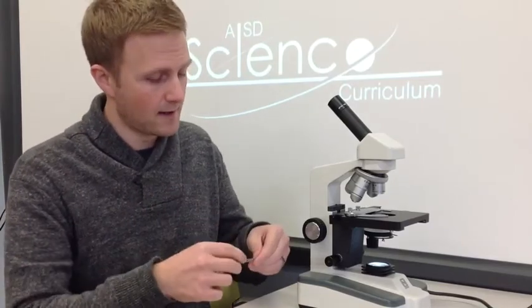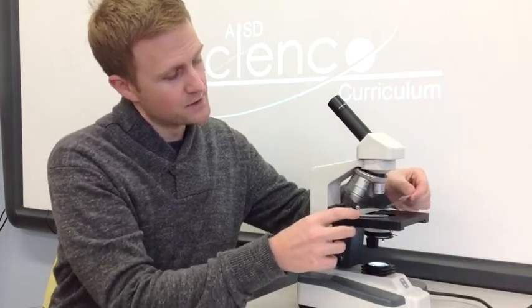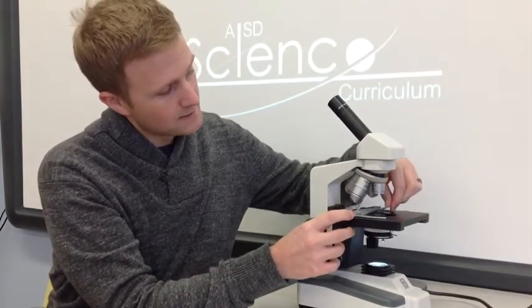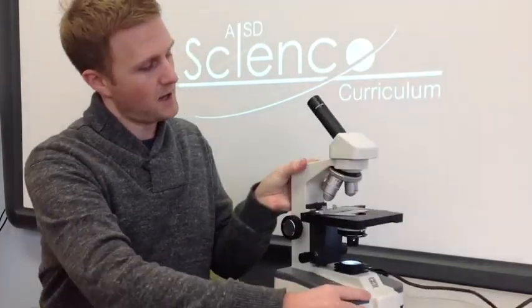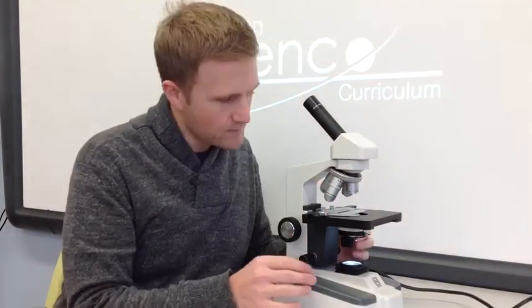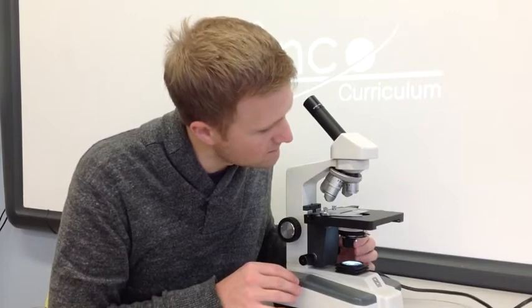So, let's put our slide on the microscope stage. I'm going to, again, open up the clip, slide my microscope slide down onto the stage, and now I want to get the sample, which you can see with your eyes, over the light source. Again, remember, we have these 2 knobs on the other side that we can use to move the stage around. Just to get started, let's make sure our sample of cells is over the light source.